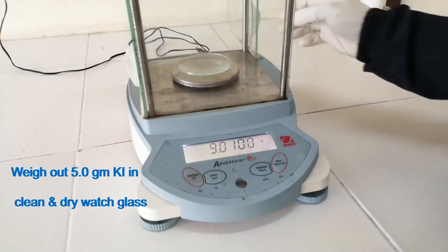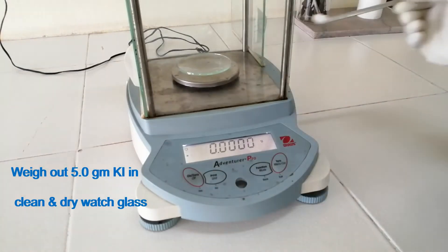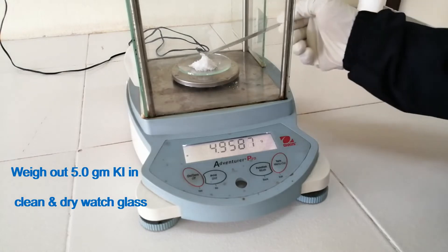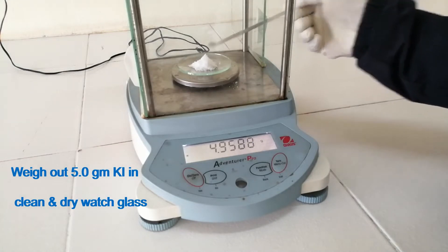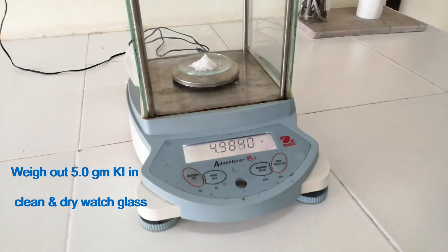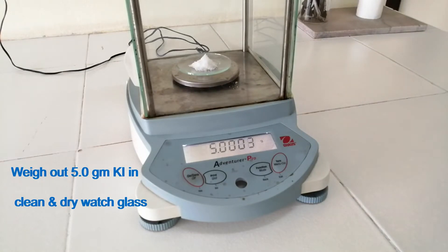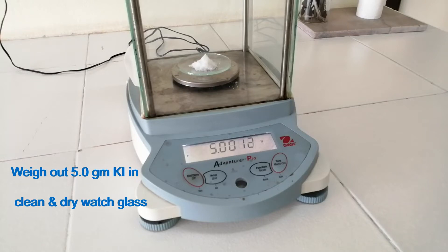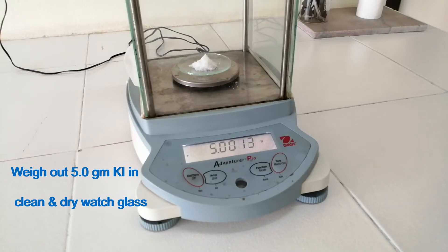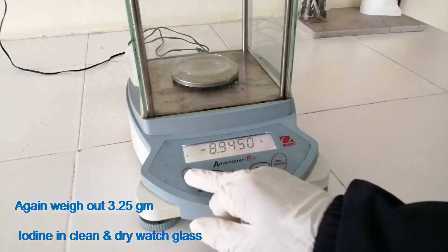Weigh out 5 grams of potassium iodide in a clean and dry watch glass. Weigh out 3.25 grams of iodine in a clean and dry watch glass.